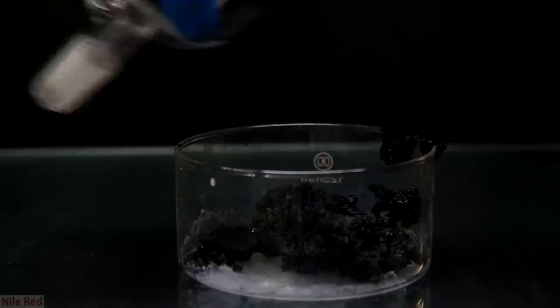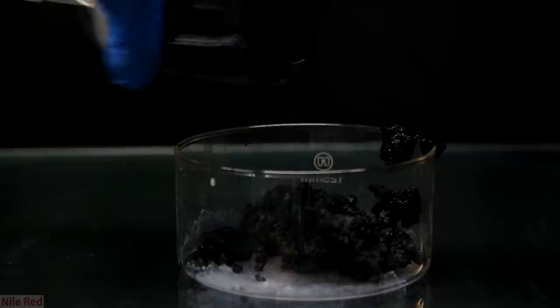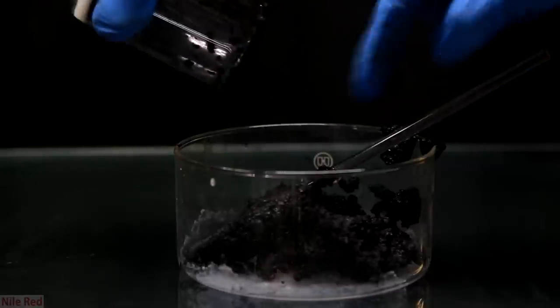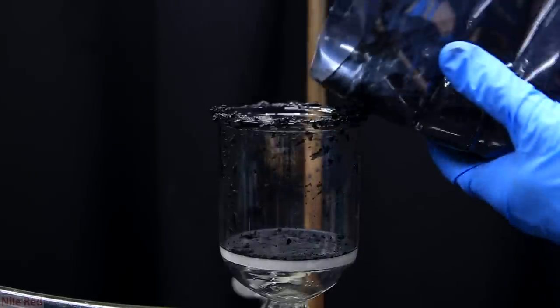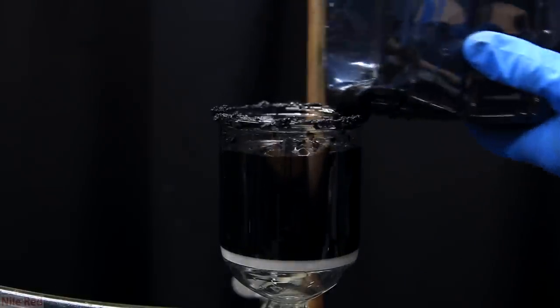You might notice at the bottom of my crystallizing dish looks pretty dirty but it's actually okay. I'm not really sure what it is but strong base bath, piranha solution and acid washes don't get rid of it. I continued to filter the rest of the solution that remained in the bucket and then I also transferred that to the crystallizing dish.